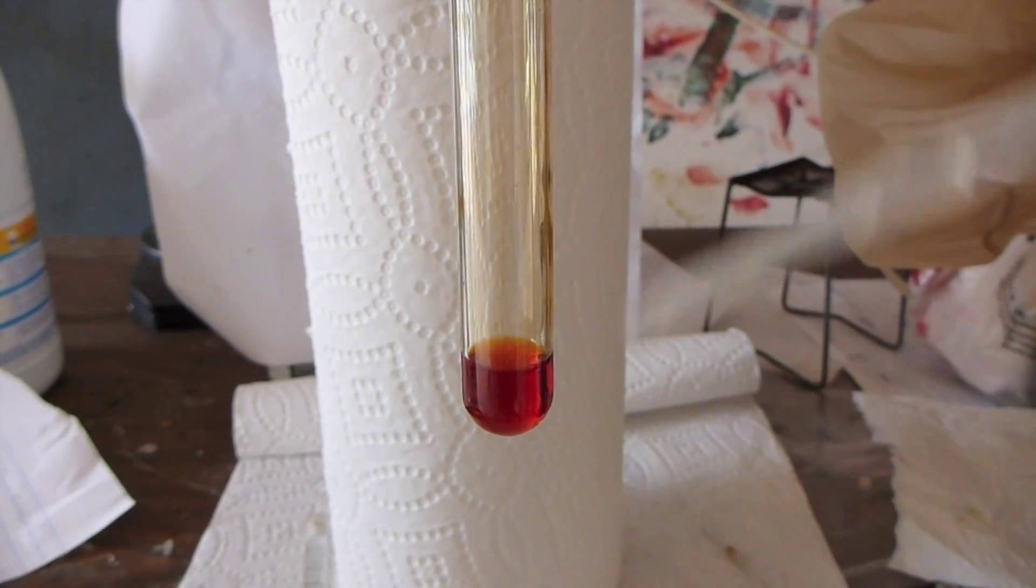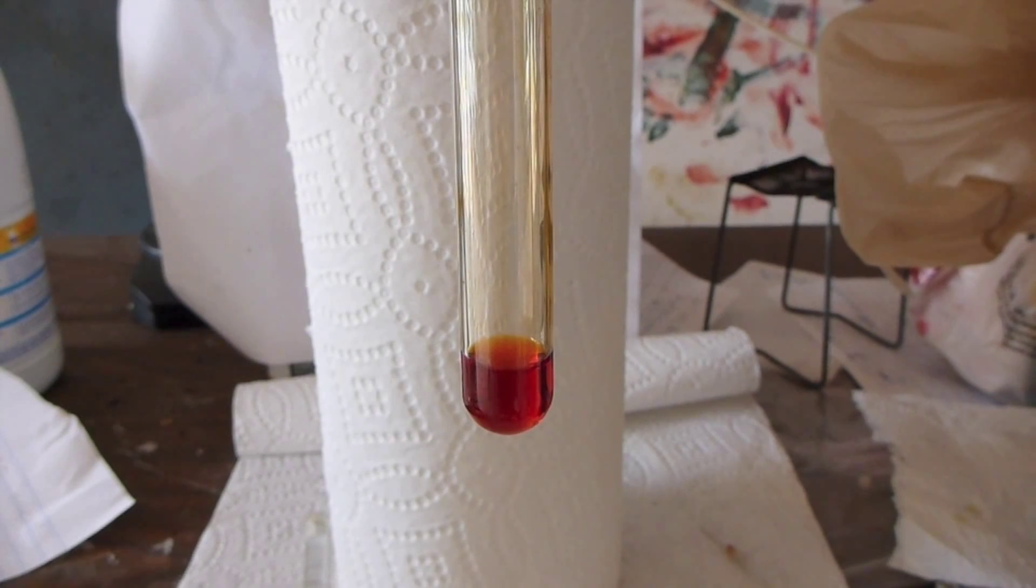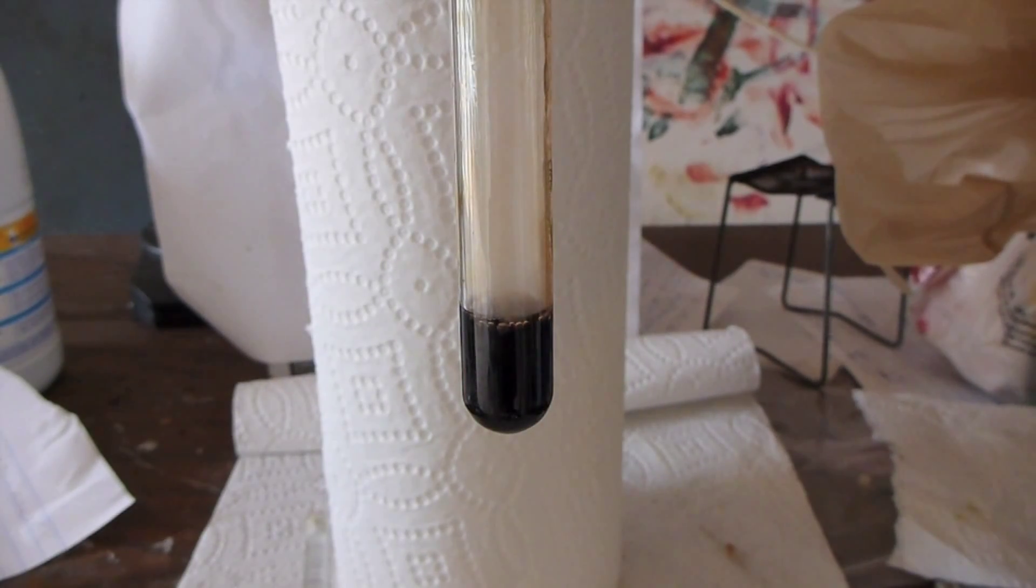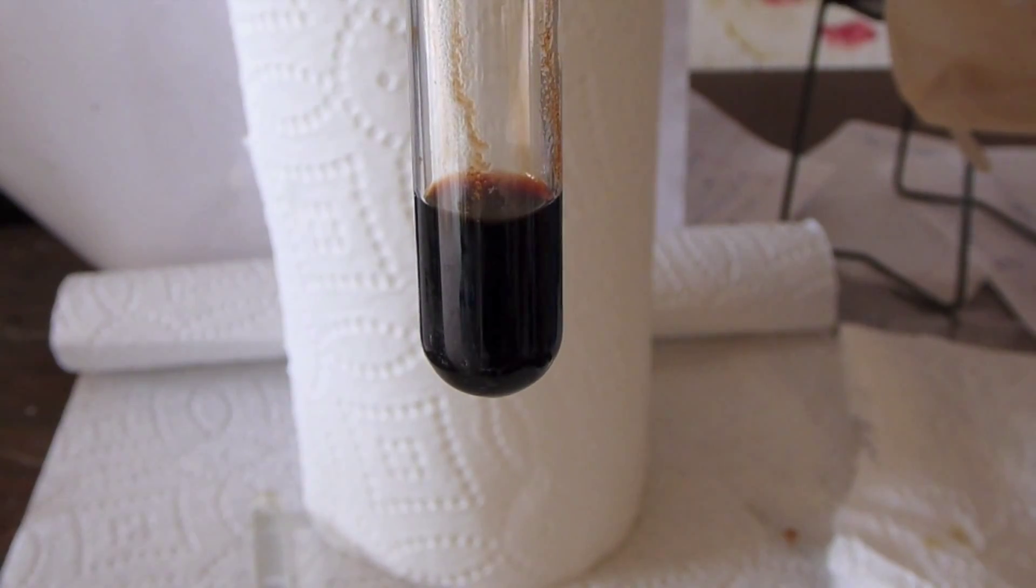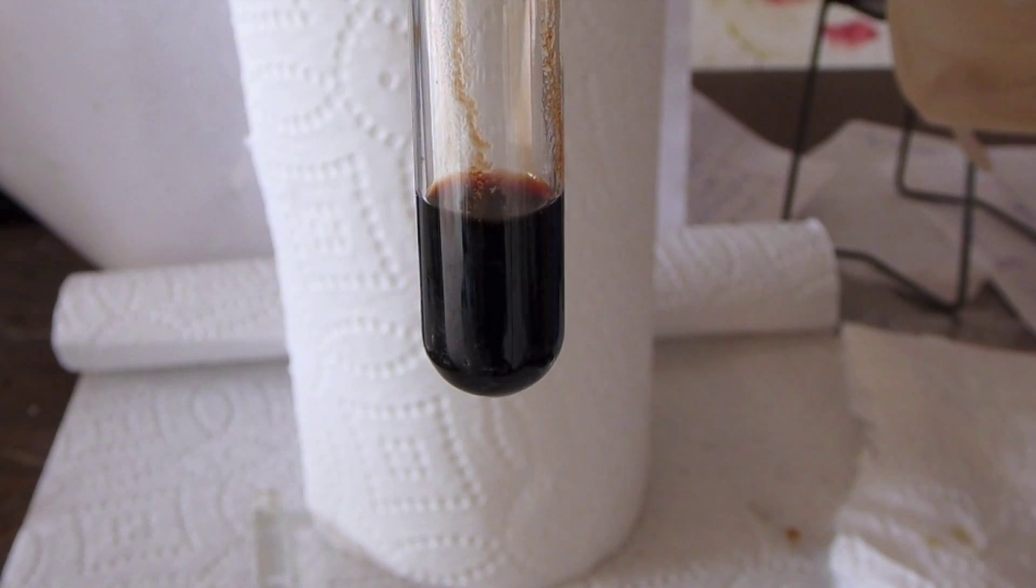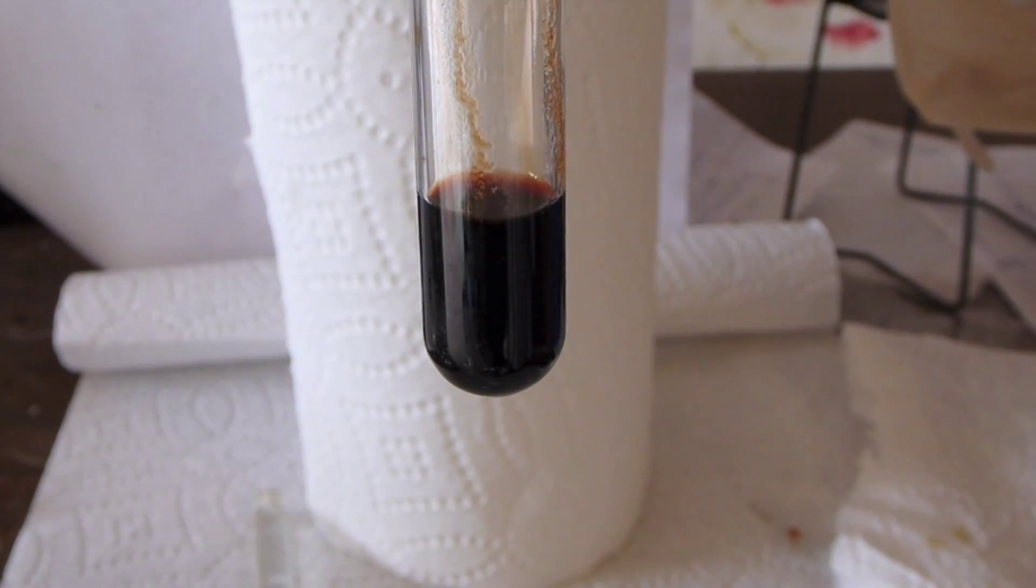All right, so I'm now going to acidify the solution with some hydrochloric acid. All right, it has been acidified. Looks like maybe it disproportionated. I'm not sure. I'm going to now add some zinc to reduce it.